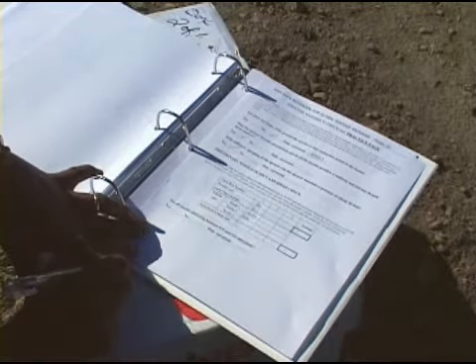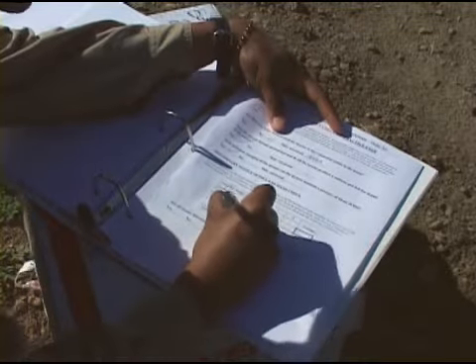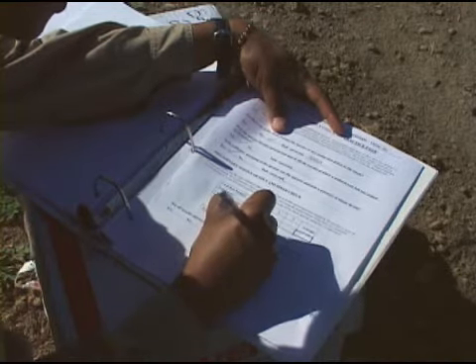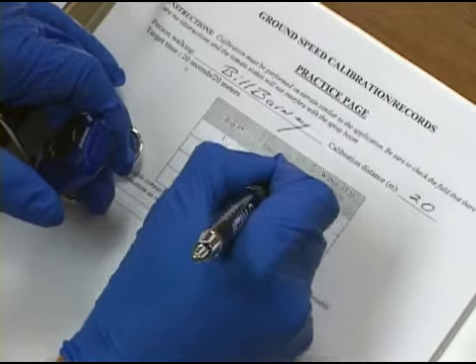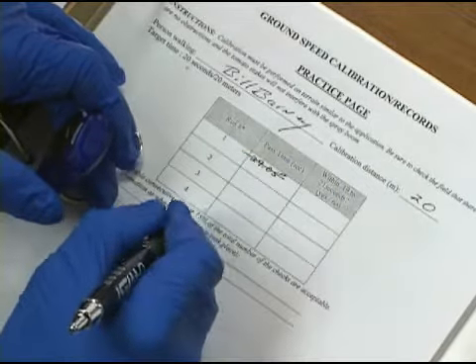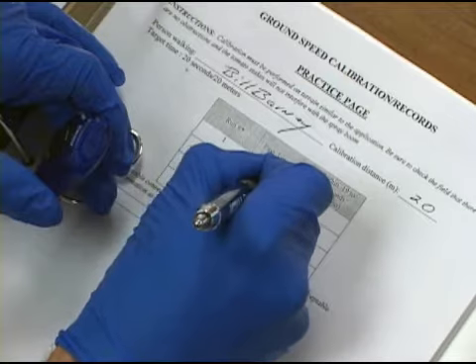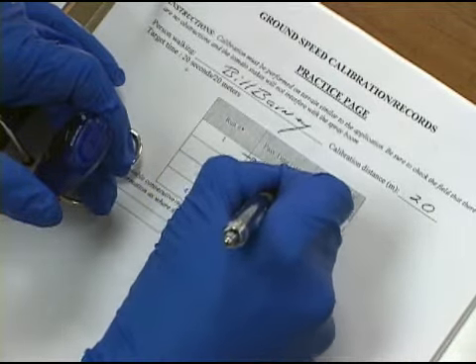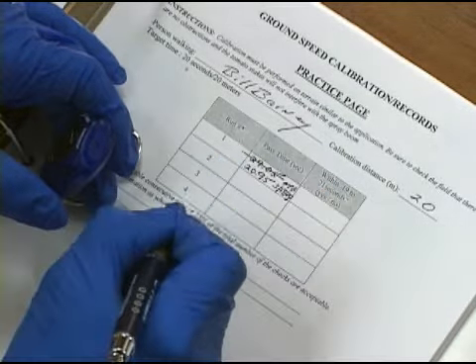During the course of the trial, you will need to enter all information about what you did into the raw data book. This information should be entered as soon as possible following all your activities. Sometimes errors occur during a trial. If you need to correct an entry in the raw data book, draw a single line through that entry and write in the corrected information. Do not erase, write over, block out, or use whiteout or correction fluid on the incorrect entry. Simply draw a single line through that entry.